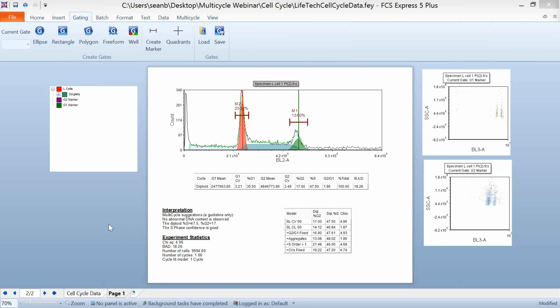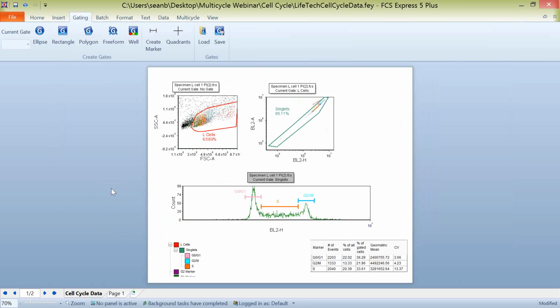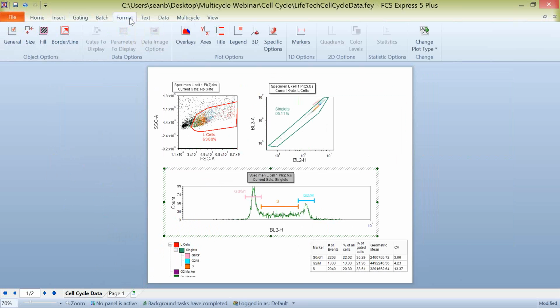Now, the other thing that we can do in FCS Express in relation to multi-cycle plots is, a lot of times, if you have been working with histograms and maybe you didn't know that multi-cycle existed, maybe you've just purchased the full version of multi-cycle, or you just wanted to compare a histogram to a multi-cycle plot. If you have a histogram already created in FCS Express, you can simply select that histogram, come into the Formatting tab, and change the plot type to a multi-cycle DNA analysis plot.